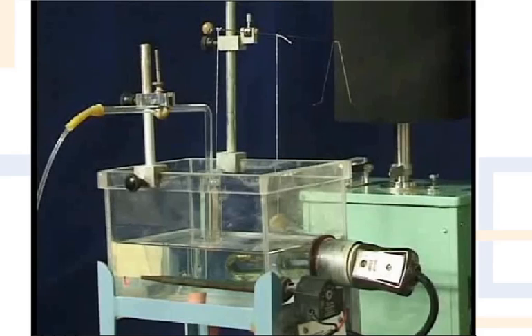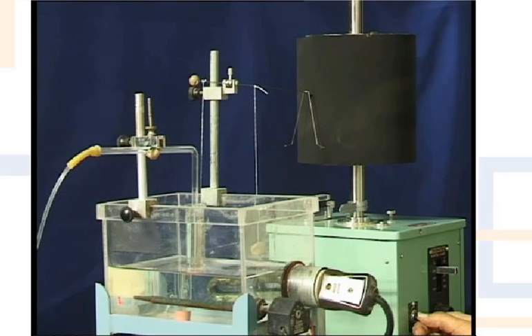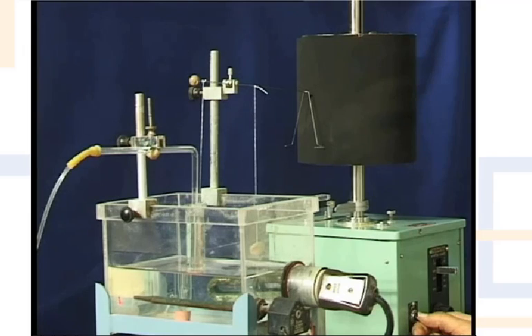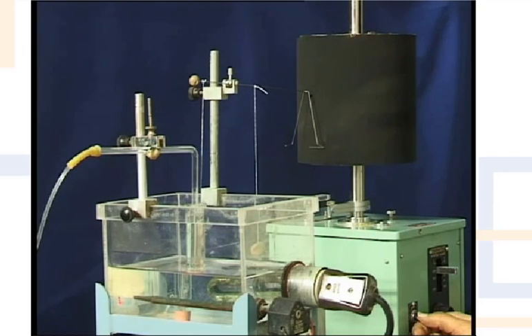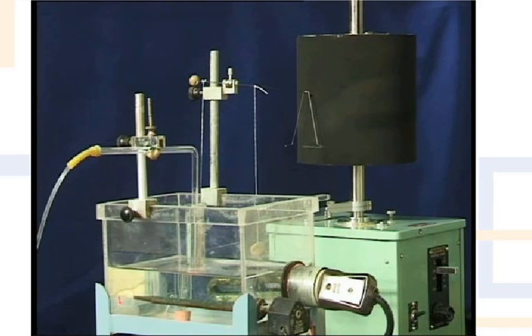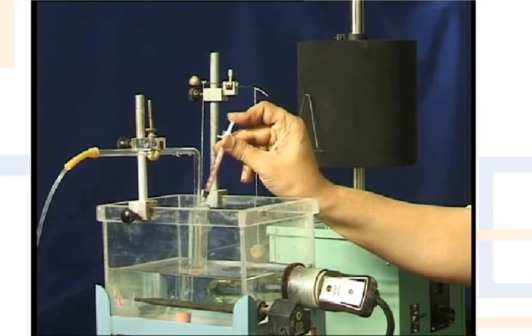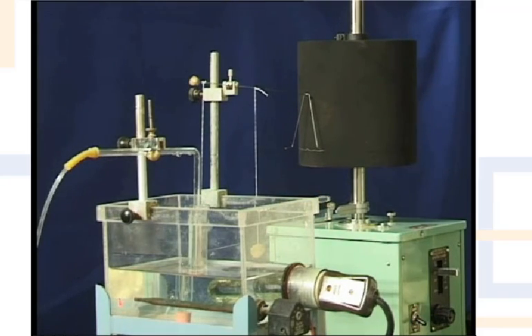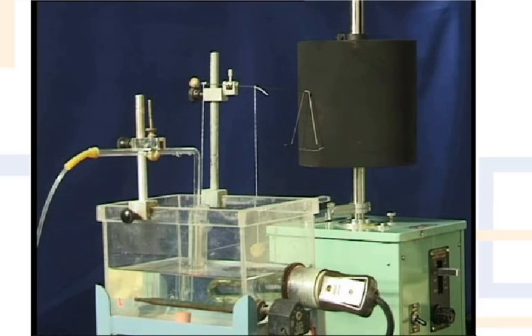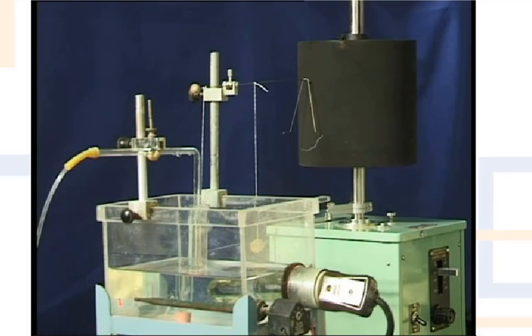A tension of 0.5 to 1 gram is applied. During stabilization, wash with fresh Tyrode's solution at least four times. Start the drum and take a baseline for about 30 seconds on smoked paper. You will see the guinea pig ileum under normal conditions show pendular rhythmic movements evident from the pattern of tracings. Now stop the drum and inject 0.1 ml of stock solution of acetylcholine into the reservoir containing the ileum. Start the drum immediately and record the contractions for 30 seconds.